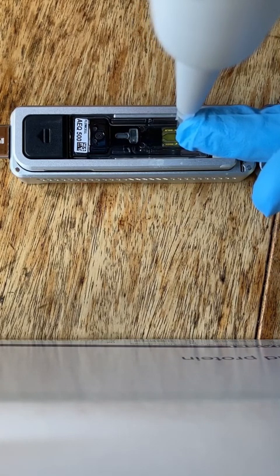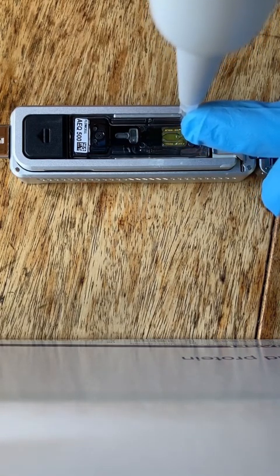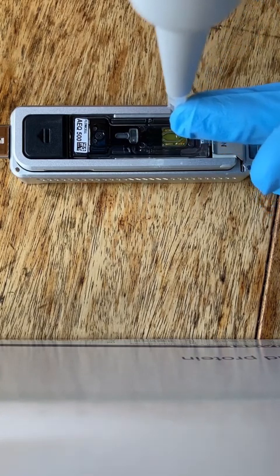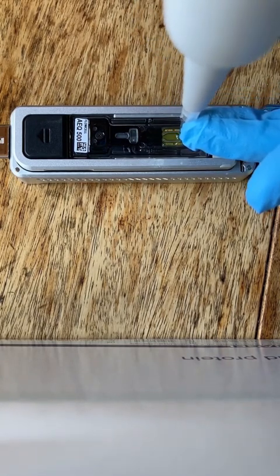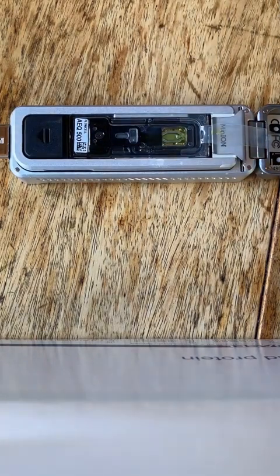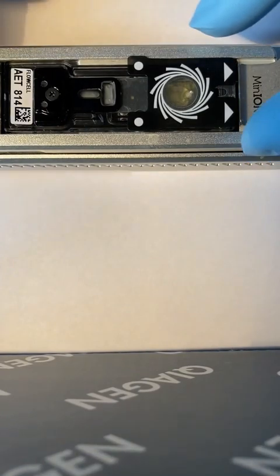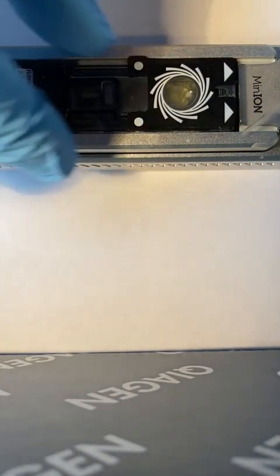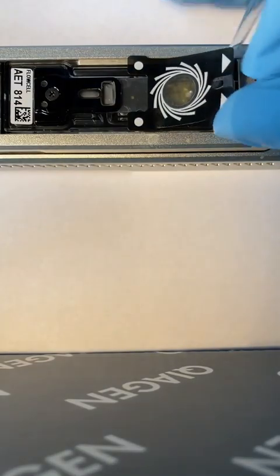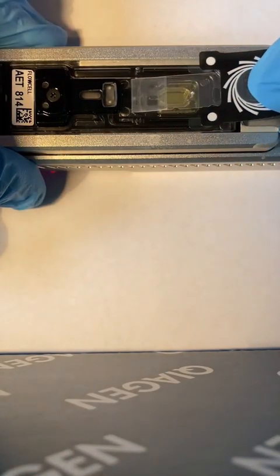When that happens, that gets frustrating because the device is ready to run, the sample's ready to run. We set that up. We know it has some pores, but you can see that I'm struggling to get the liquid to actually go into the sample port. I keep calling it a pore, but it's a sample port. So eventually I got that one in. This is another one, which I ran the next day, showing you with a little bit better video how it works. You want it to work.